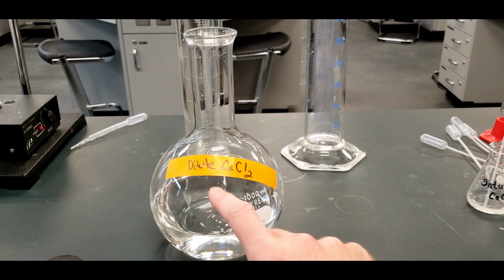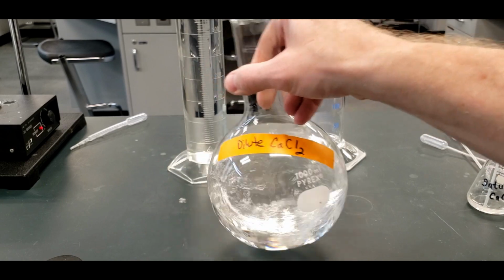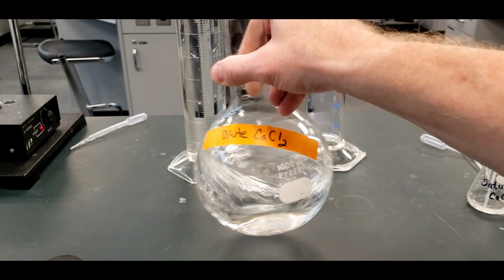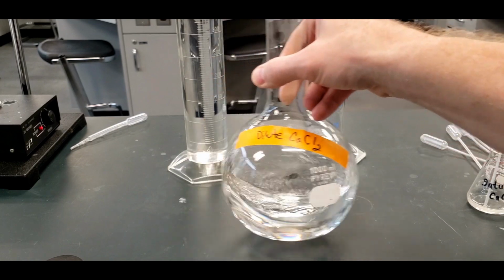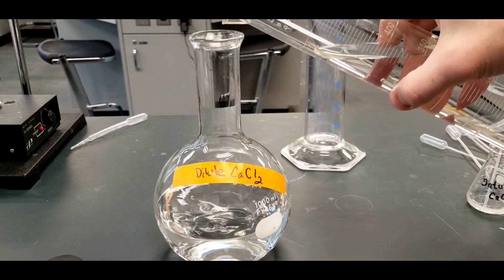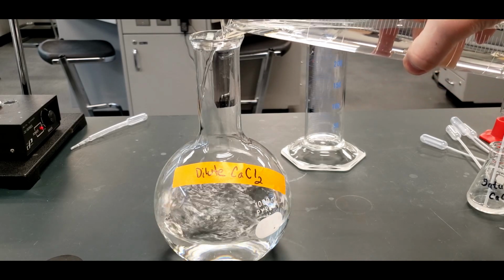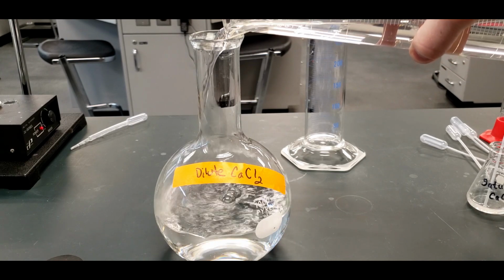Now we have 10 drops in here, and we put it into water. So you put the water in first so that you can get it nice and mixed thoroughly. But we don't put it all in, not yet. So that's probably pretty good. And then you put in the other 400 mils. We're going to assume that the volume of the droplets is very small compared to this 800 mils.